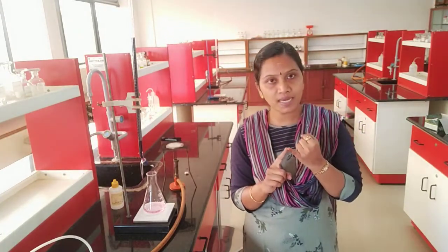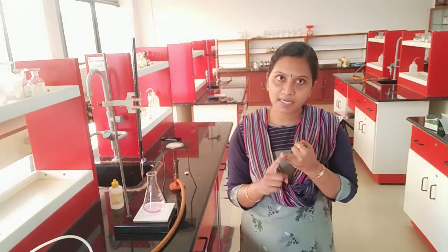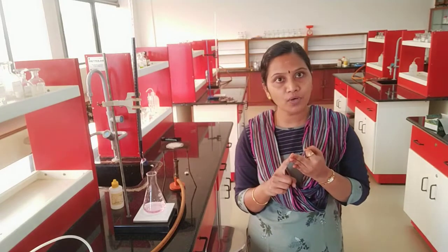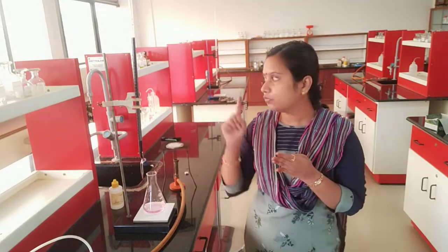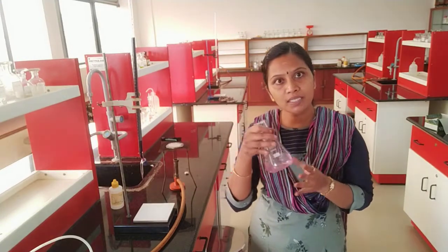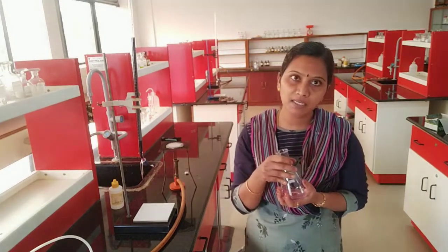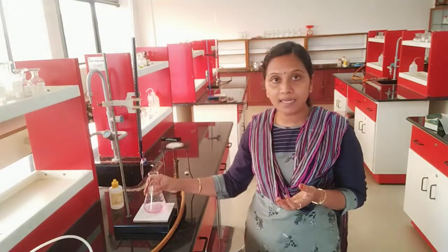We covered the preparation of standard solution of oxalic acid, preparation of standard solution of Mohr's salt, titration of KMnO4 against oxalic acid, and titration of KMnO4 against Mohr's salt. In both these cases there is an appearance of pale permanent pink color which is the end point. We don't have any separate indicator here because KMnO4 itself is acting as a self indicator. Thank you.